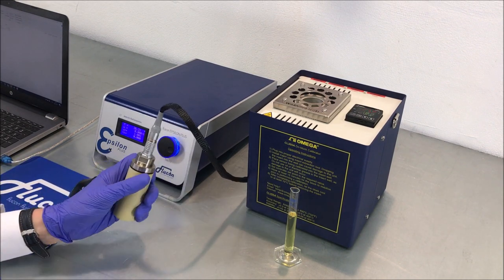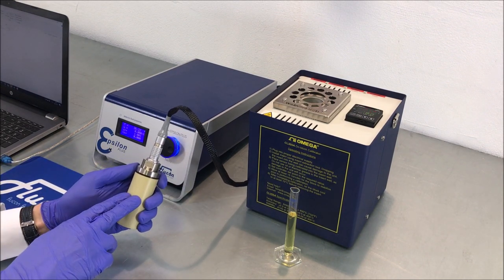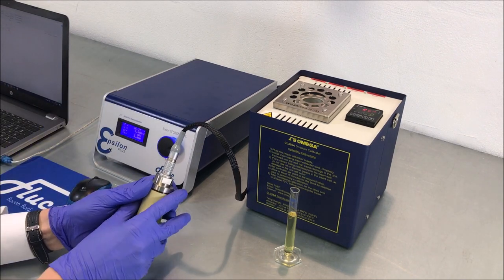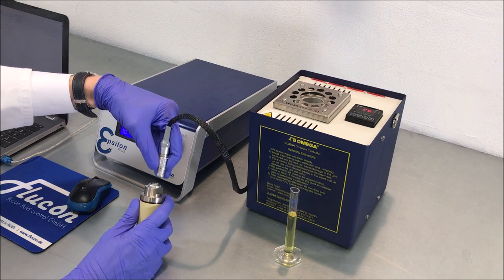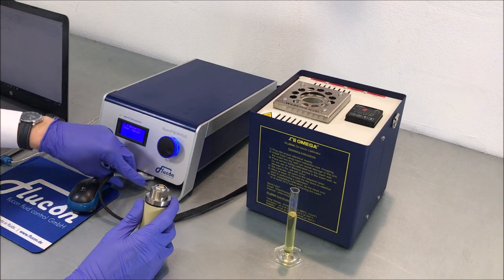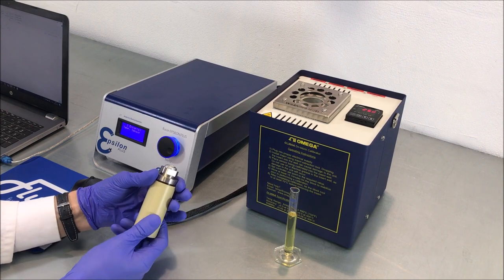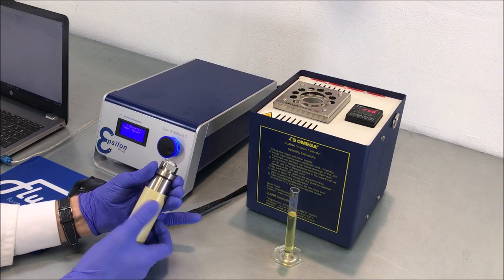First of all, unplug the sensor cable from the sensor. In order to do so, simply pull it up but please do not turn the plug. Now pull the sensor out of the heat resistant adapter sleeve.